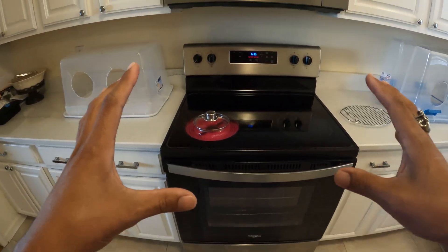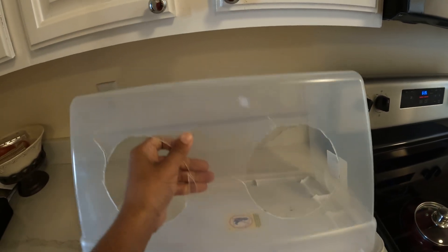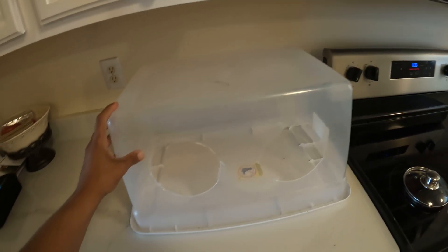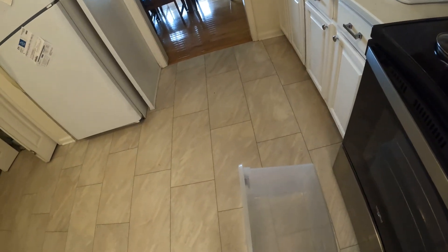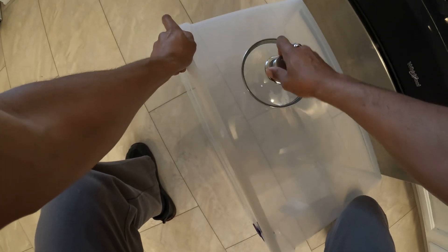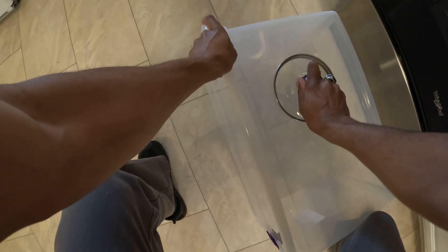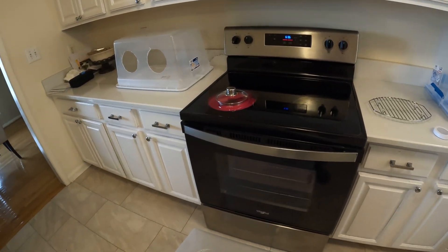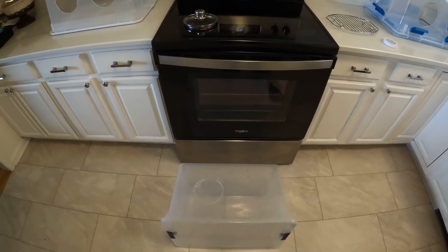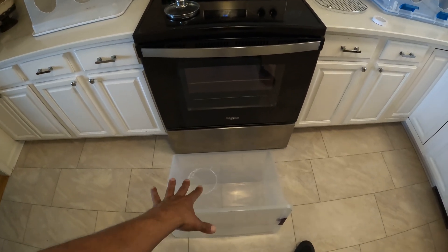What this is going to allow us to do is make really good holes. When I first started, I tried to use a blade — it will work, but you're gonna crack it, and if you get a bad enough crack it's not gonna be usable. A lot of times it'll pop when you've got it hot enough. Just really take your time, no rush. Let that heat up again — it's gonna stink because of the plastic, but if you let the plastic cool when you're done it'll just peel right off. So we got one hole that's ready to go.